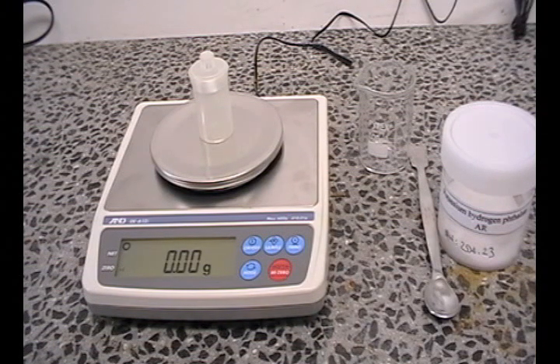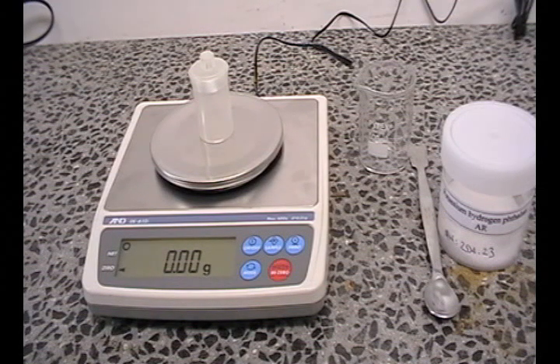You are now ready to transfer the substance into the empty weigh bottle. However, it is not good practice to transfer the substance whilst the bottle is on the balance. Therefore, take the bottle off the balance.